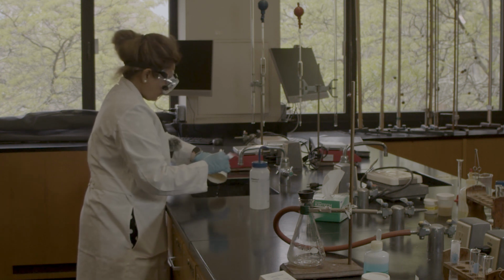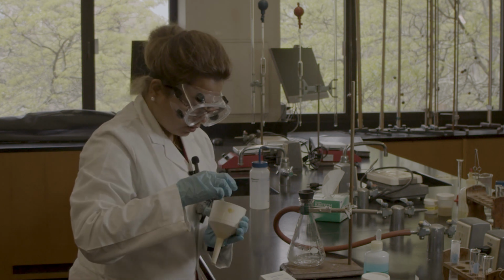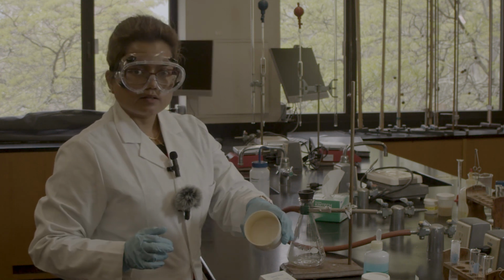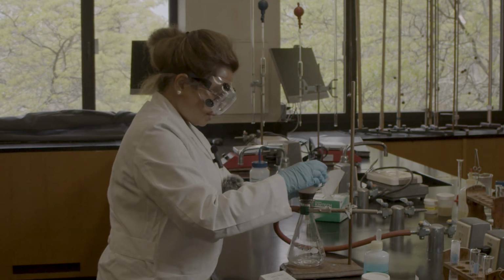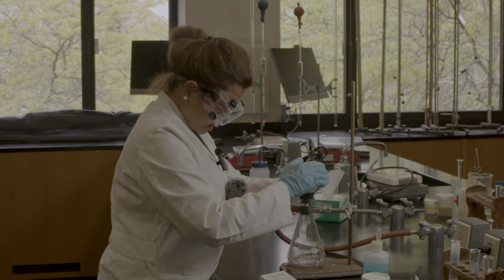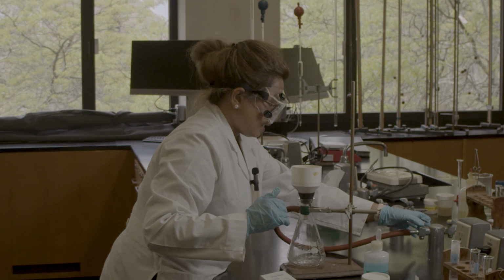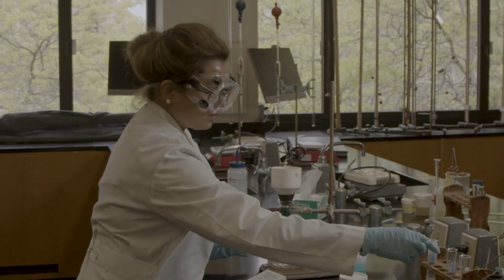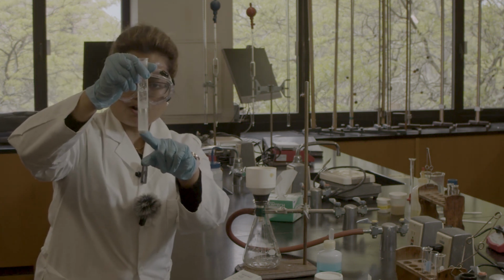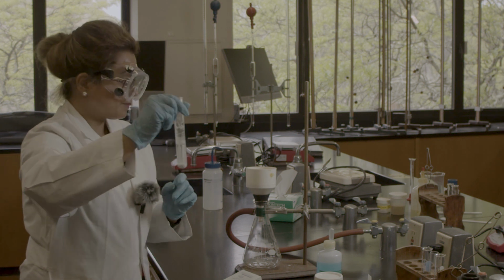The filter paper sits there so that no hole is open. Now I'm going to put it inside. It's a cork, which helps so that no air comes out. So now I'm opening my vacuum valve. You can see now, after mixing it up, my chalk is at the bottom. There's total clear water. So it's not soluble, it's insoluble.